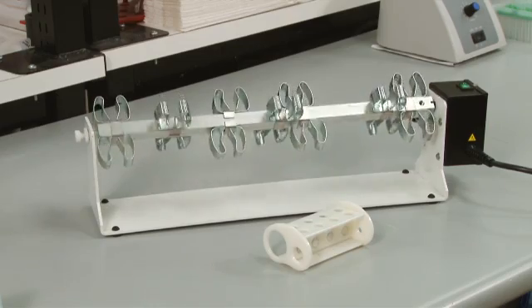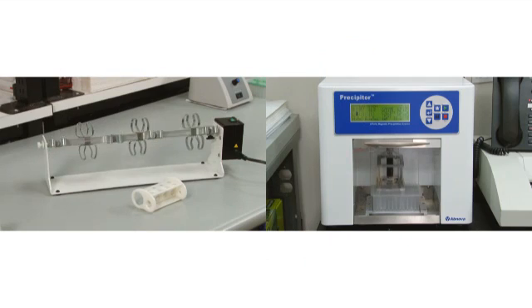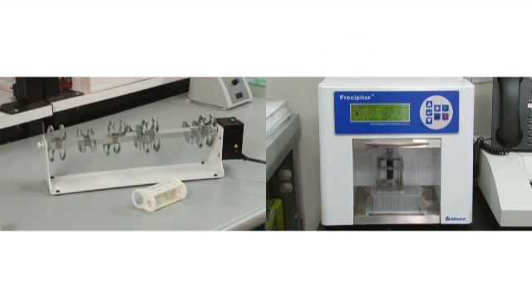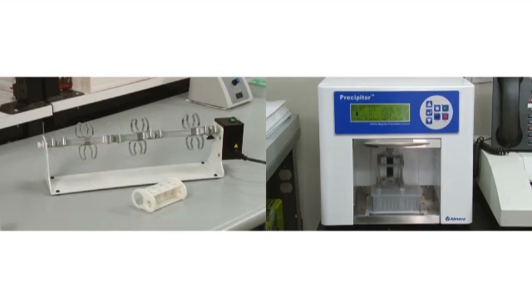Next, we can begin our wash steps. Wash steps can be performed manually through the use of a rotator and magnetic separation rack or automated with a machine designed for this use.